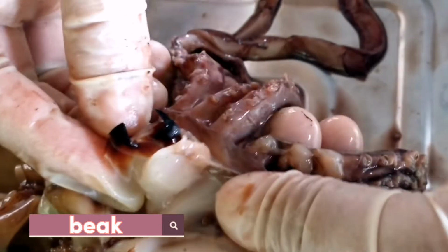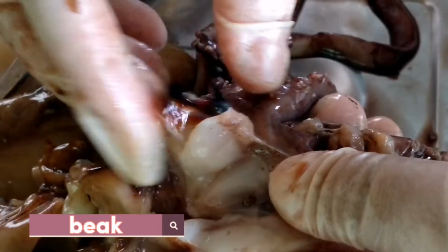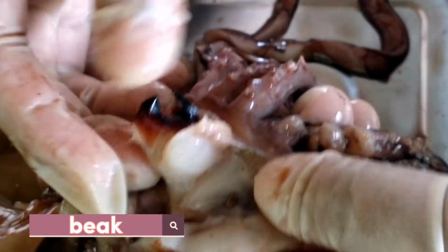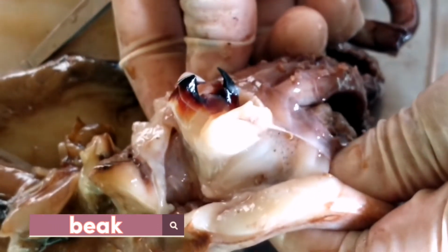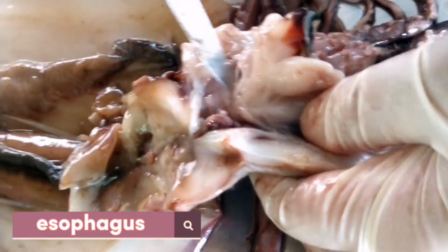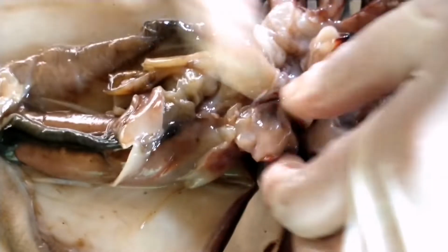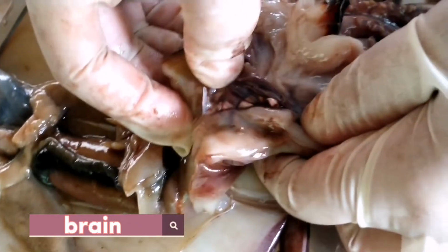And this is the structure of the beak inside the mouth, which looks a lot like a bird's beak. This hard, sharp structure is used to kill and cut up prey. And above and connected to the buccal mass is the esophagus. And right over here is the squid's brain.